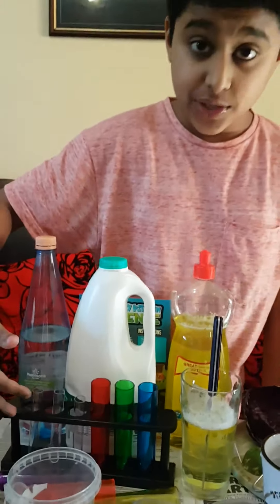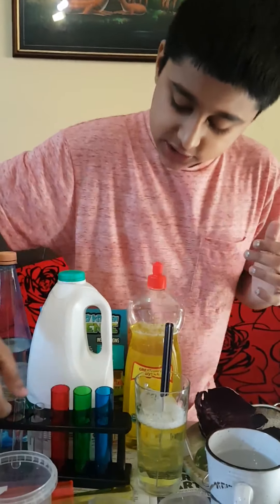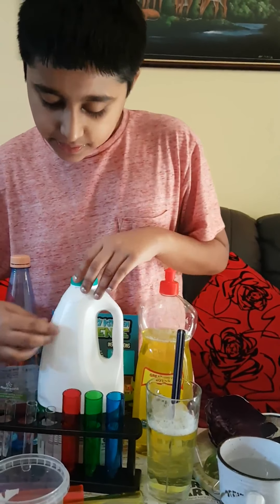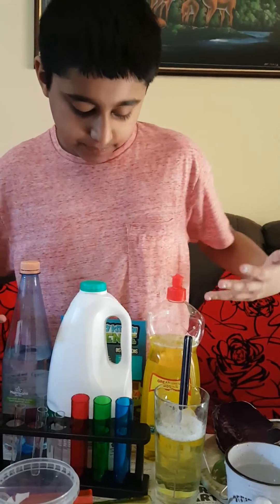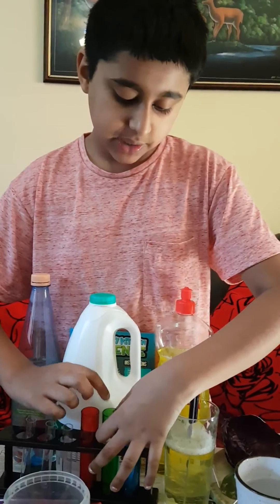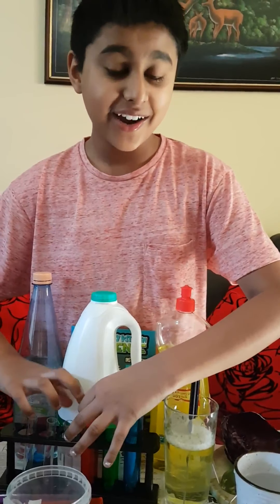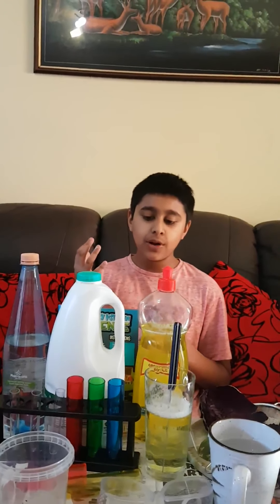I've done three transparent test tubes so you can see them, and three more. These three are going to be for different liquids. This one is going to be neutral, this one is going to be very highly acidic, and this one is alkaline — in the middle with a pH of about 10 to 11.